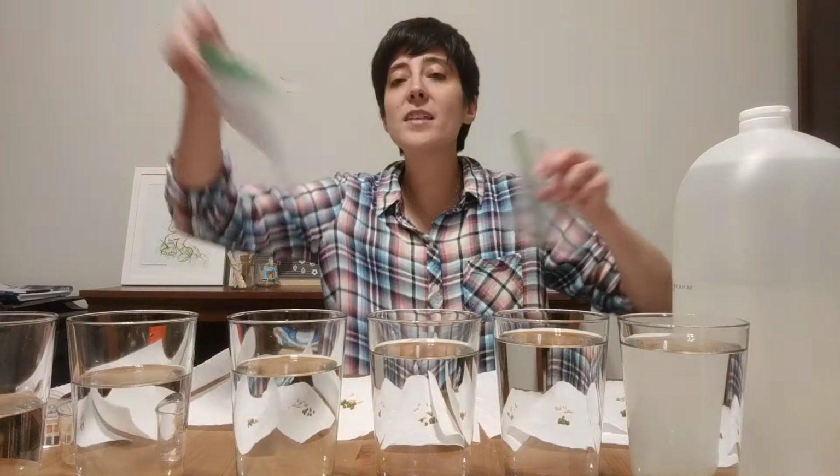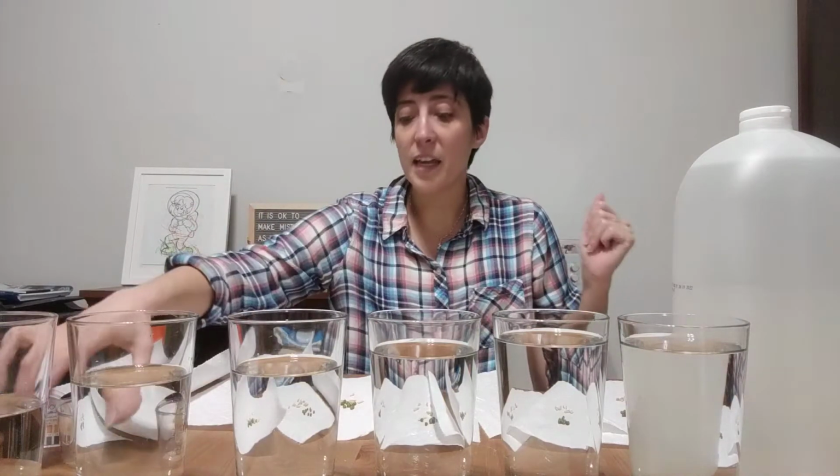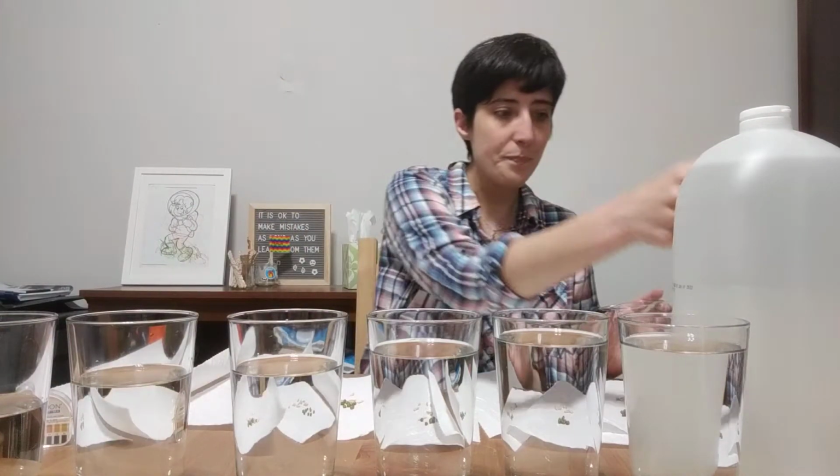That is because I'm going to have you guys calculate the percents. So that's the first part of this lab that you're going to have to do, is calculate what the percent is of vinegar in each one, so that you'll need that to complete the lab assignment.